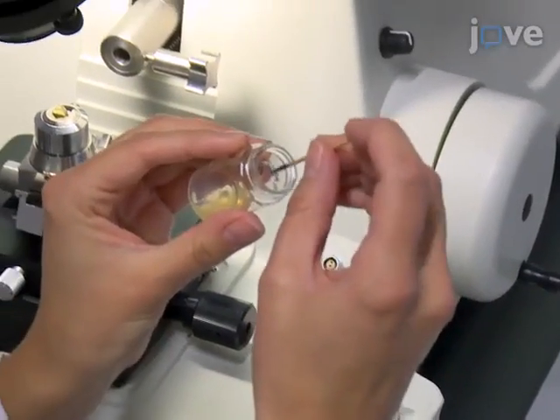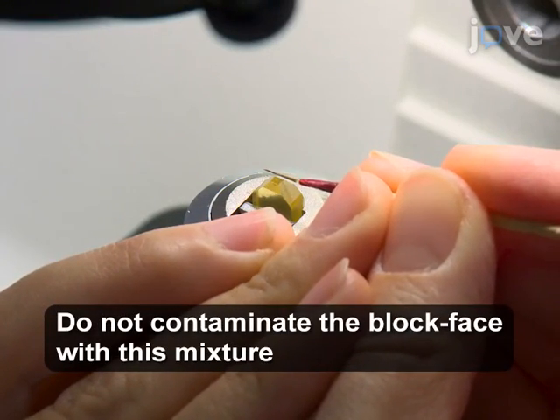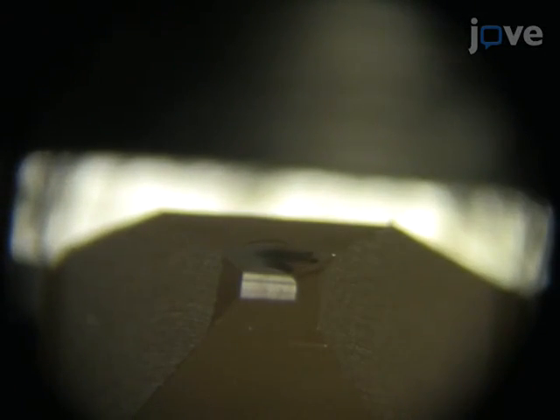Using a tiny brush formed from a few hairs fixed to a toothpick, carefully coat the leading and trailing sides of a pre-trimmed block with an adhesive mixture. Perform this step quickly because the solvent of this mixture evaporates within seconds.